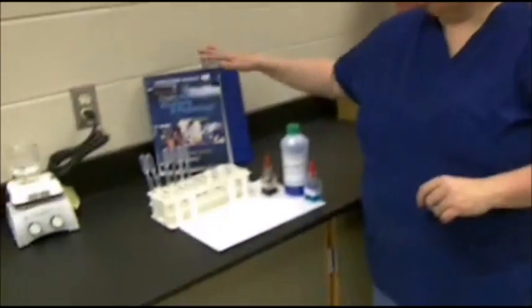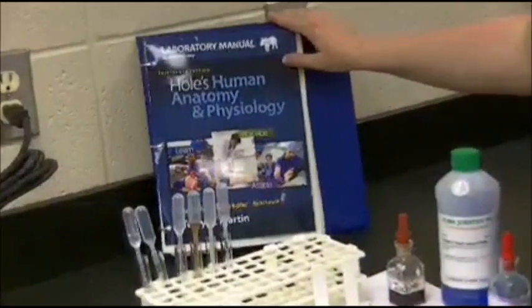For lab exercise number 3, part C, we're going to test some different types of test specimens for your organic molecules, and that's going to be our proteins, some simple sugars called monosaccharides, and then some very complex sugars called polysaccharides or starch. And these are the things that we're going to be using. We're going to use, of course, the lab book.